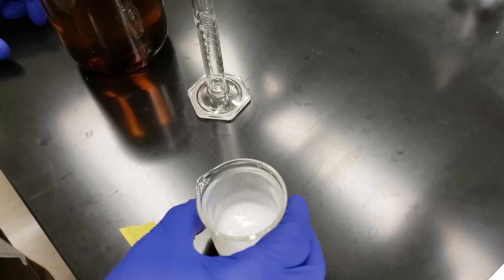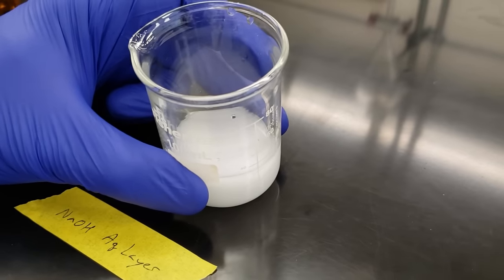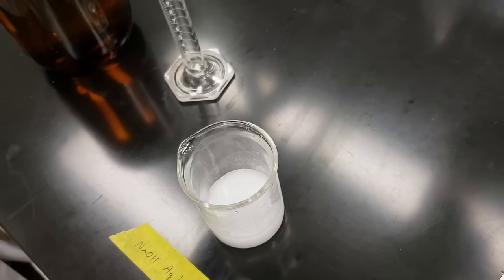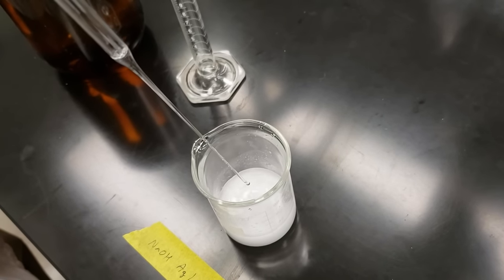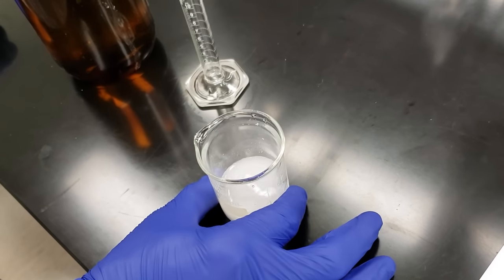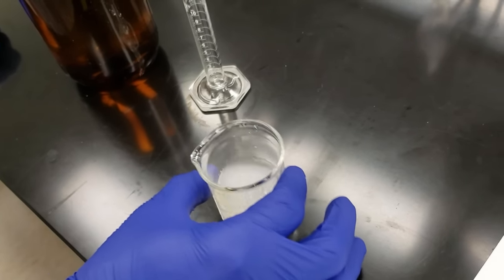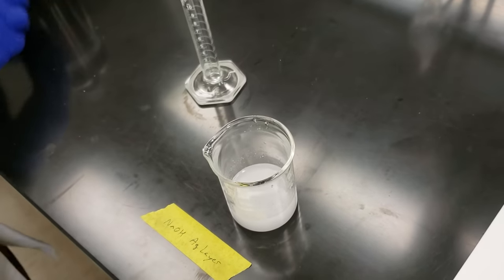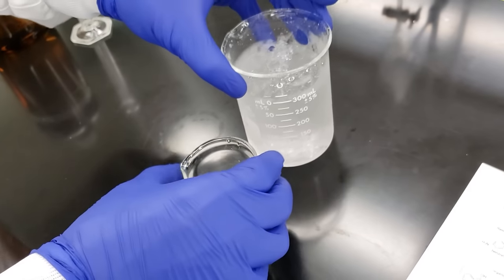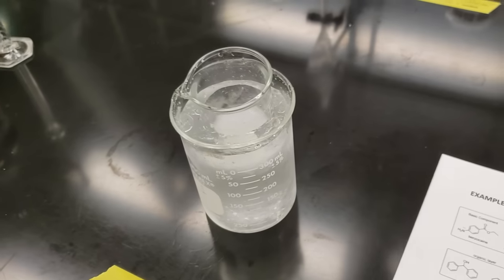Now we're starting to see that even upon swirling, the cloudiness remains — we're starting to precipitate our crystals. We do the last little bit of our addition here. Swirling the flask again — it is getting a little warm to the touch, not hot, but warm. We can definitely feel the exothermic effects of our acid-base neutralization reaction. We'll place this beaker into an ice water bath and let it sit for a couple of minutes, just as we did with our benzocaine, to force the formation of additional crystals. We'll come back in a few minutes and check them.